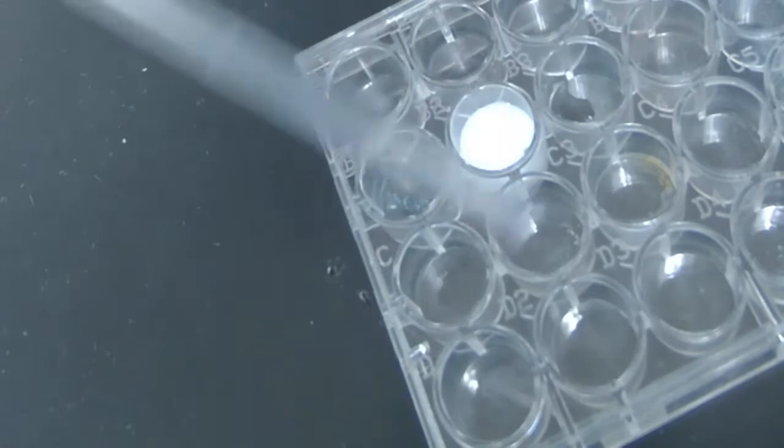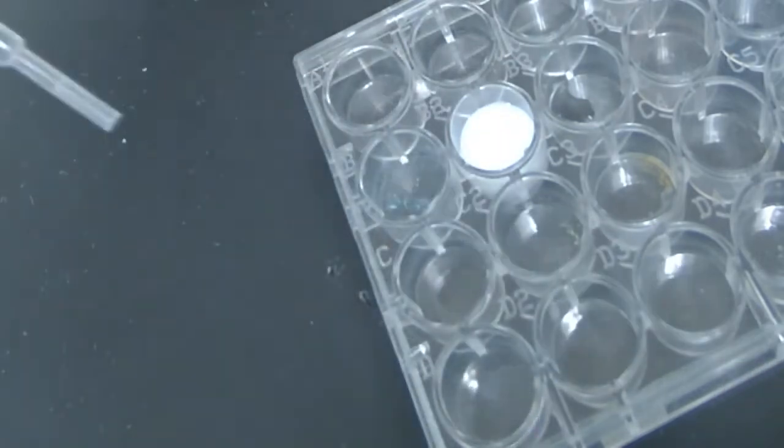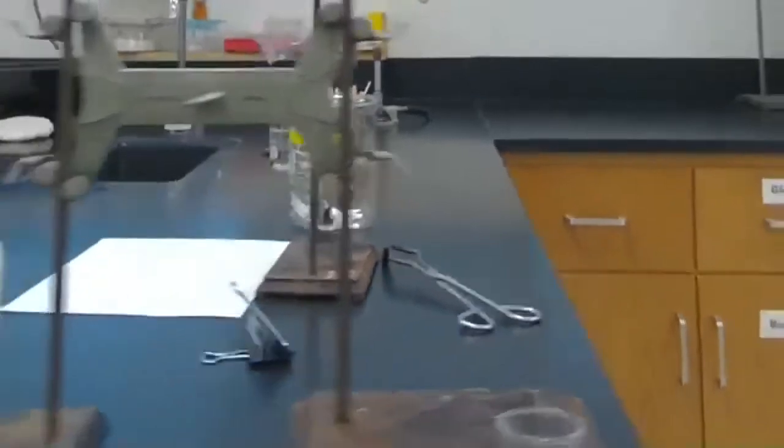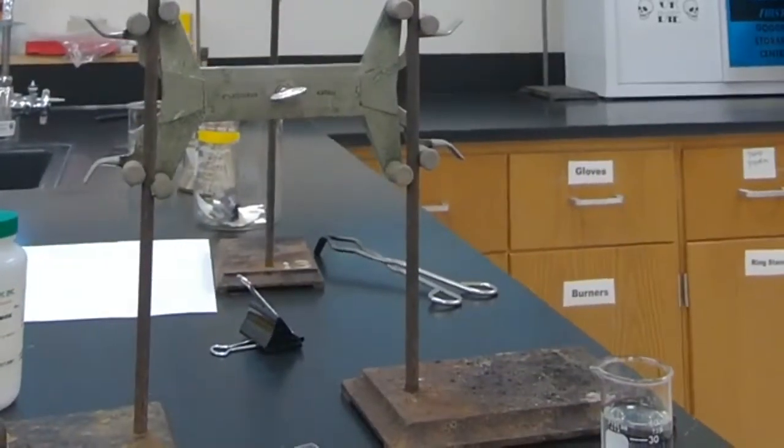You notice that's a clear substance in that pipette there. Definitely not clear down there. Now we'll come back to this well plate in a moment because I'm going to need it for the last demo. Okay, I'm going to transition the camera again. For our next change, you got to come this way. And what you're going to see here is station 4, let me get her ready.